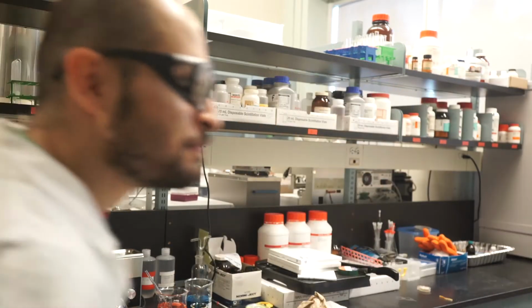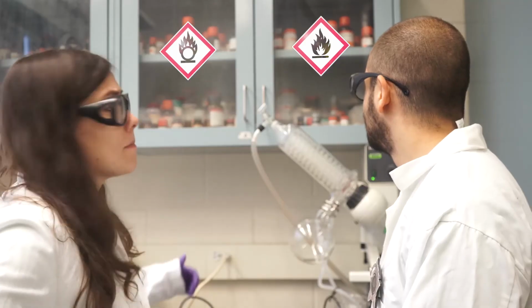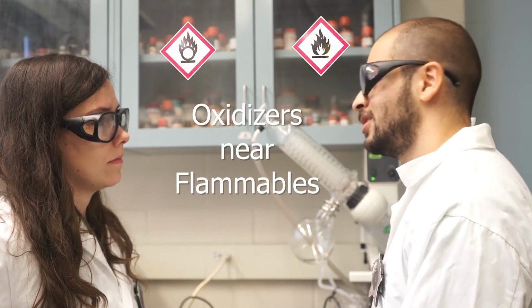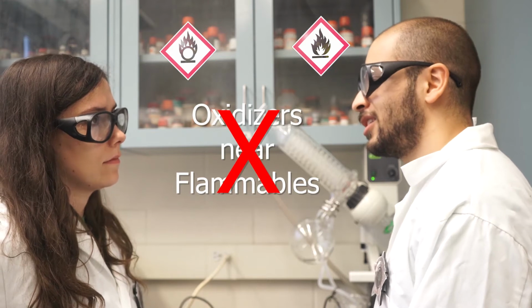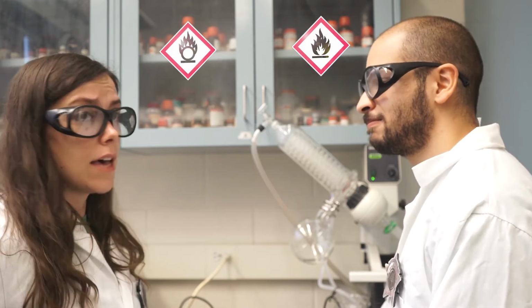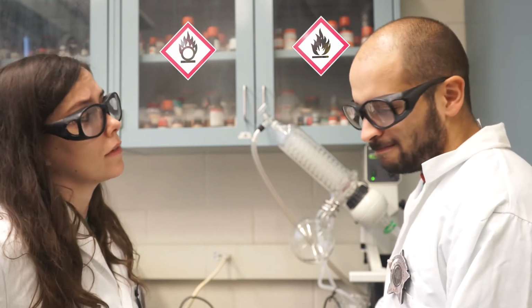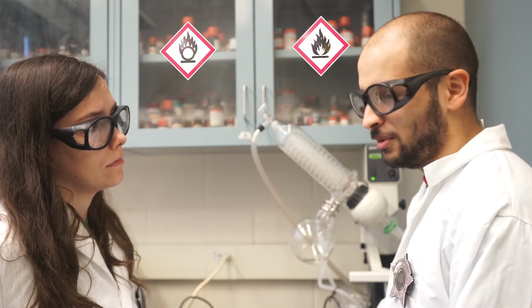And that's not all. Take a look at this. This right here is a massive fire and explosion risk. You're right. Oxidizers and flammables should never be stored next to each other. They could cause a massive fire and explosion. That puts not only this lab at risk, but people in the other labs in the building and in the surrounding area. Chemistry should never be done like this.